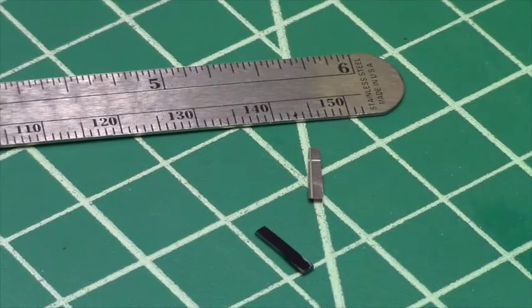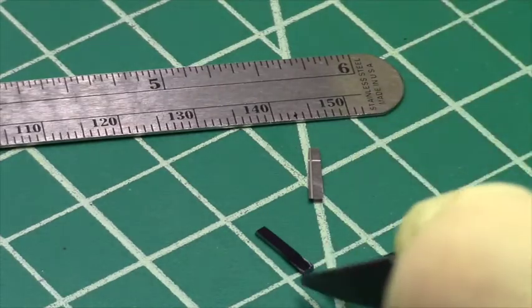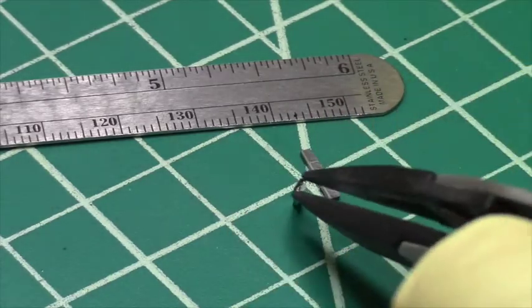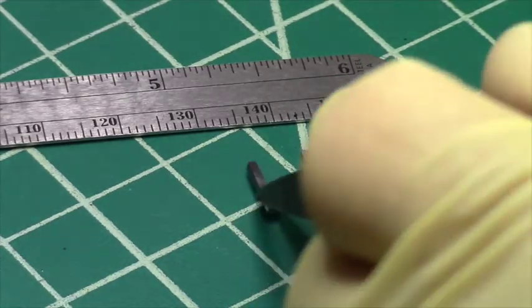Now we have two samples about a millimeter in width. We've used the small sample pliers and a standard scriber from Lattice Gear's cleaving kit to prepare these samples.